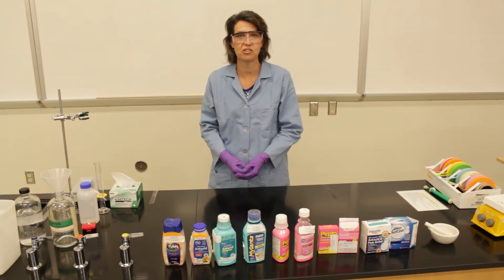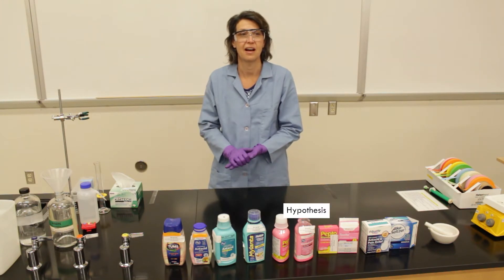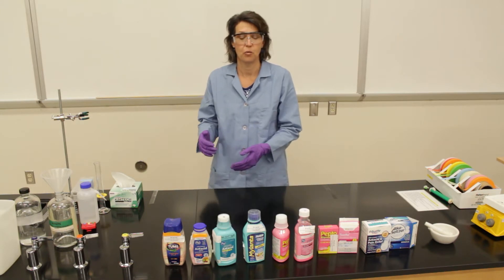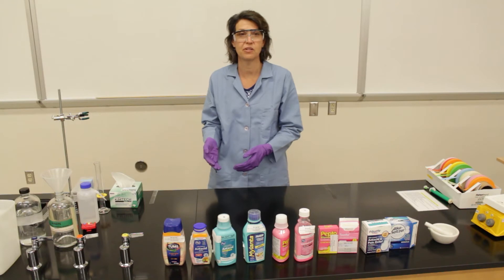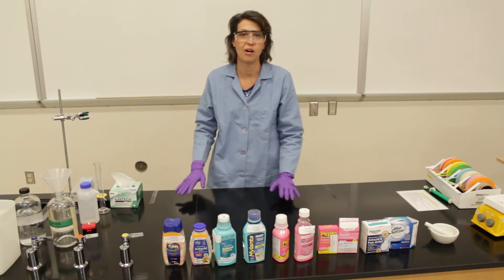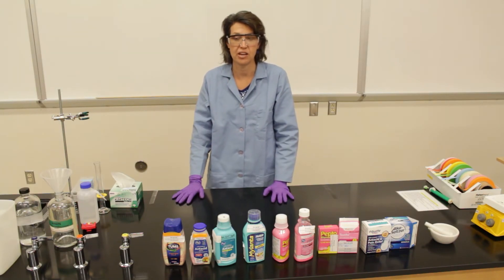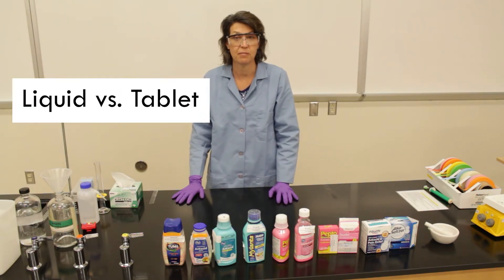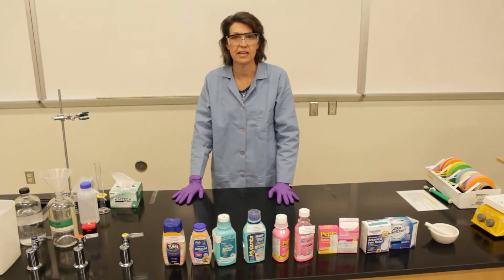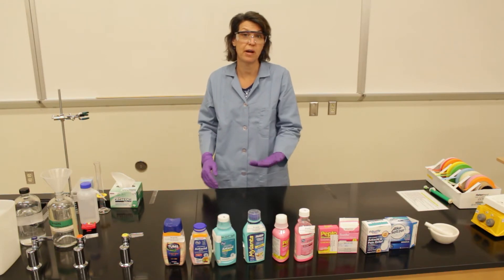We're going to have some simulated stomach acid and see how adding antacids affects the pH of that stomach acid. It also gives us a chance to explore the process of designing and testing a hypothesis. The first thing you're going to do is look at a list of active ingredients for each antacid. You'll look at the document online that has information about each antacid. You'll notice that some of them are liquids, some of them are tablets, some are brand name, and some are generic. As you look at that list, be thinking of some questions and think about what you might want to compare.